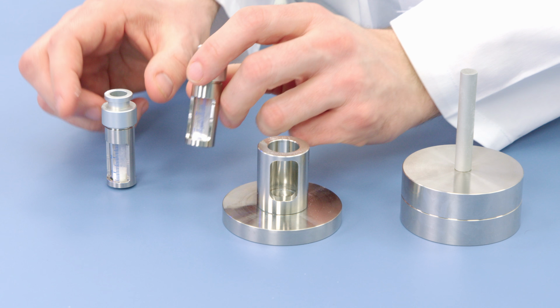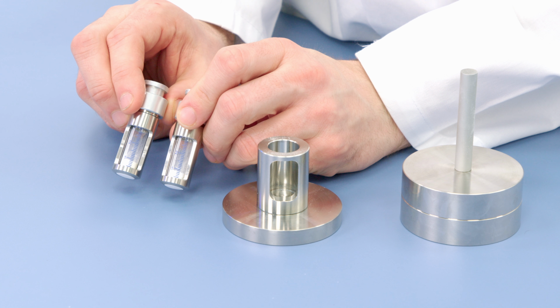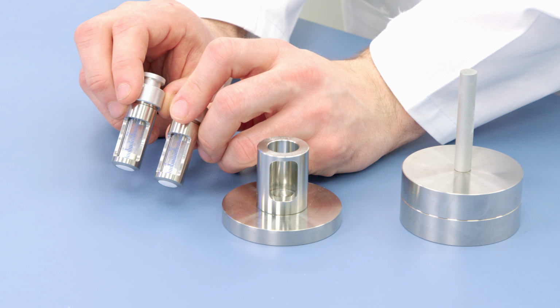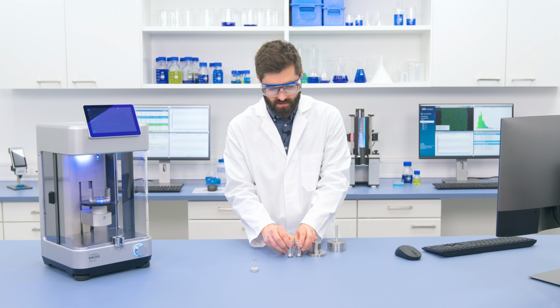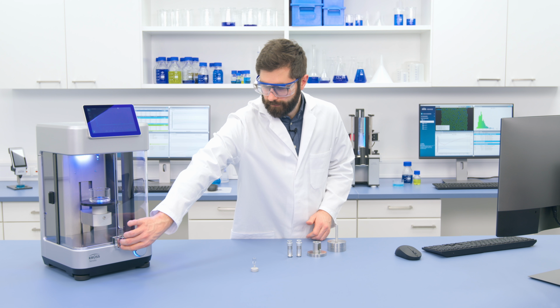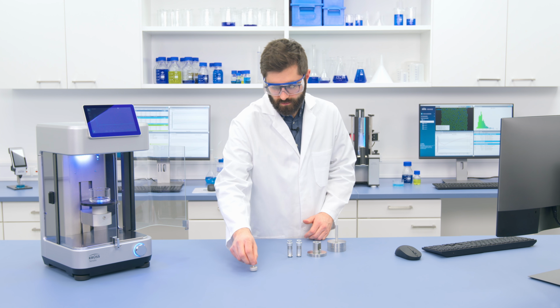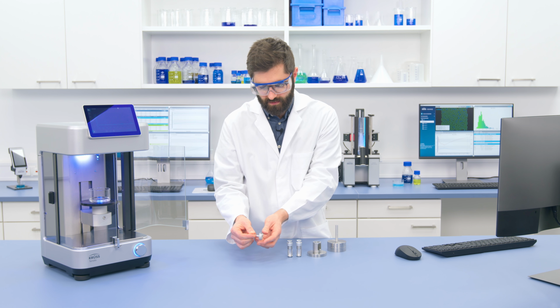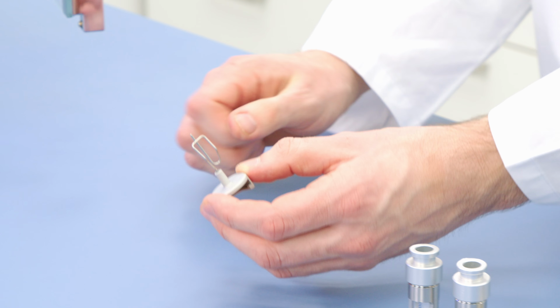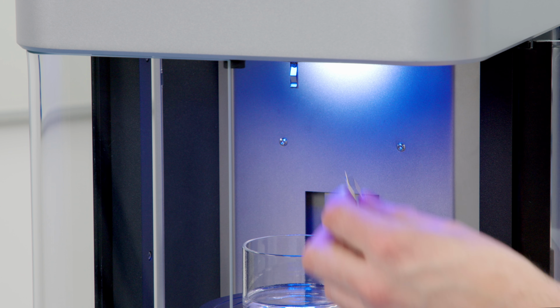And now both samples should be as reproducible as possible, both in terms of the compression and the amount of cellulose we have inside. So now we're ready, we can attach them to the force sensor of Tensíío. First of all, I take this here, so I have a small attachment that will let me attach the Washburn cells. I can bring this over to this force sensor.